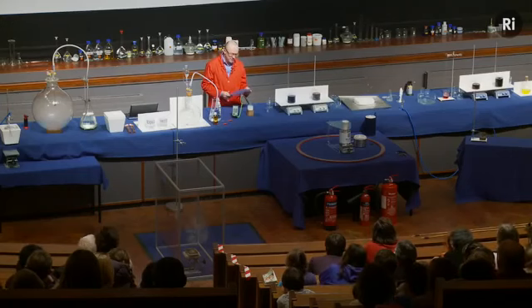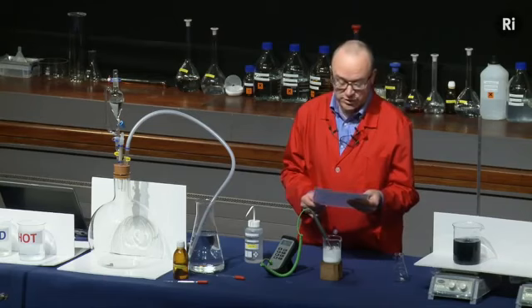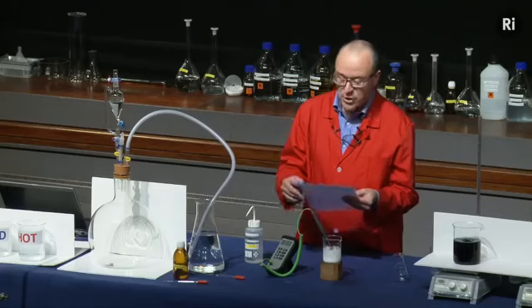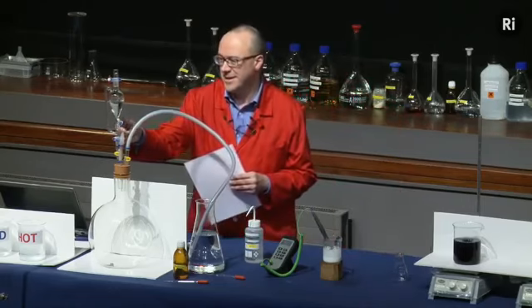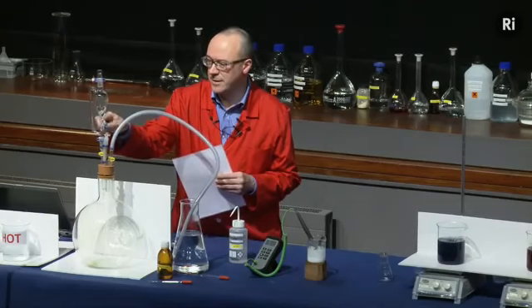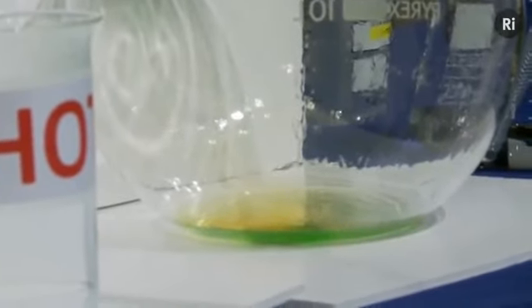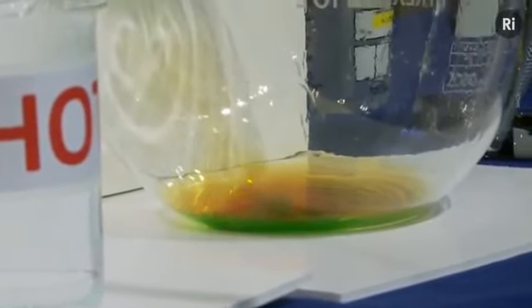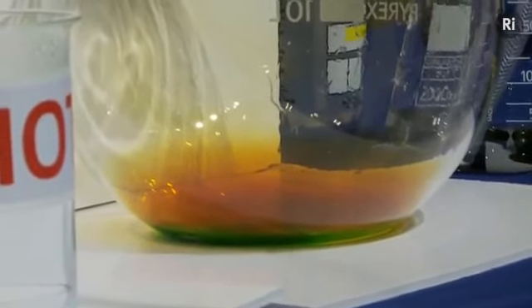All was still. In the interest of knowledge, I was even willing to sacrifice one of the few copper cents then in my possession. I put one of them on the table, opened the bottle marked nitric acid, poured some of the liquid on the copper, and prepared to make an observation. So let's add the nitric acid to the copper and see what happens. I think you can see that quite a vigorous reaction is taking place. We've got some sort of green liquid, it's bubbling away, some fumes are coming off. All right, let's continue with the story.